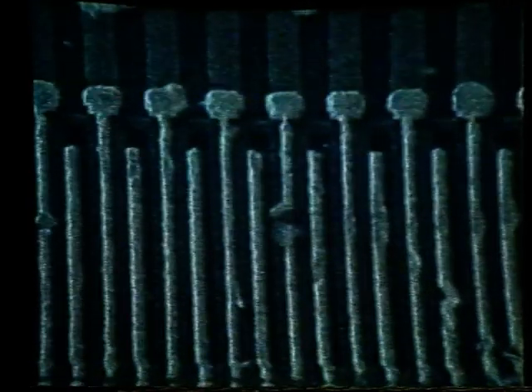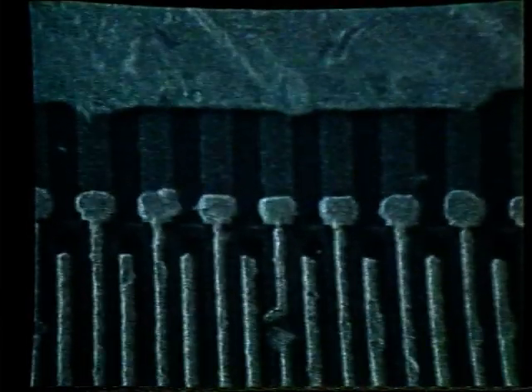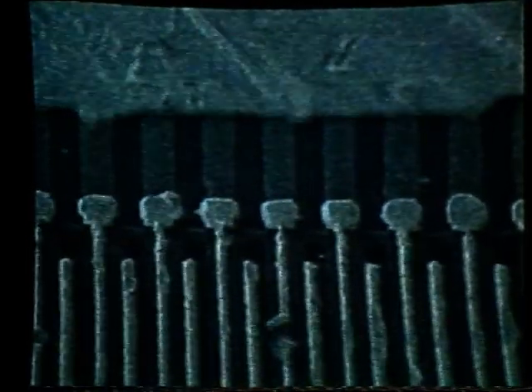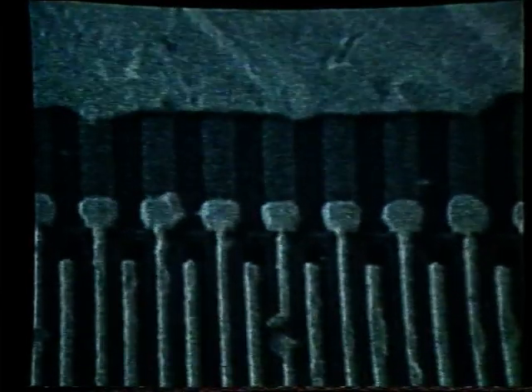Now what we can do is move the sample using the Y micrometer on the specimen stage, bringing it back to the center of the screen. We will now slew using the up and down arrows without the shift key so that we can slew in smaller steps. Again, trying to minimize movement. Once again, it appears to be getting worse there, so we can go back to a value somewhere in here.